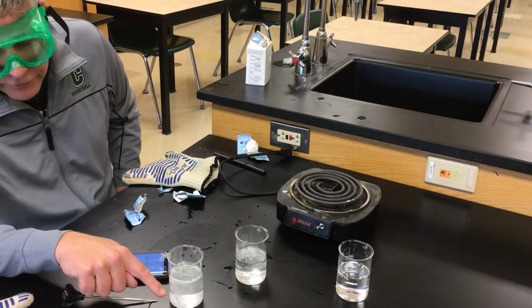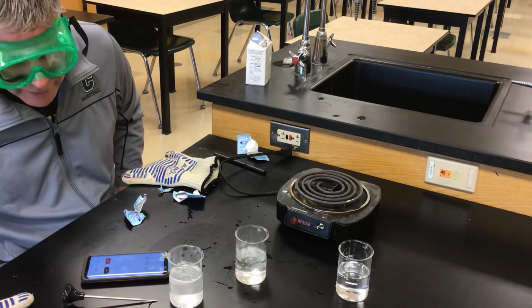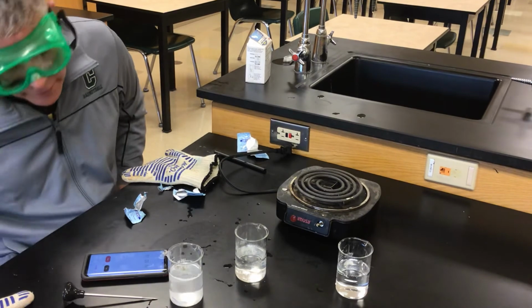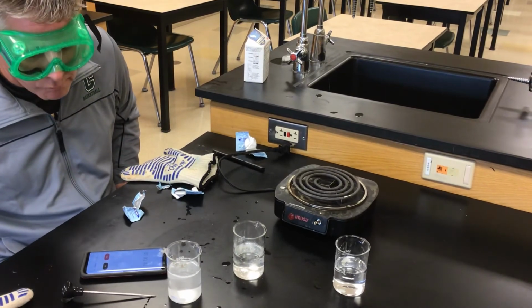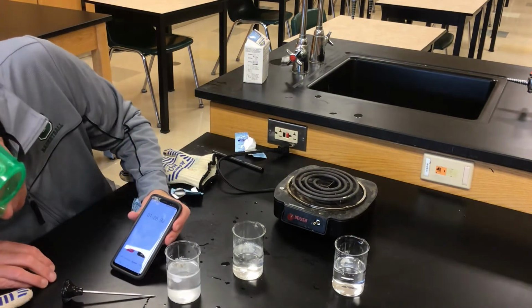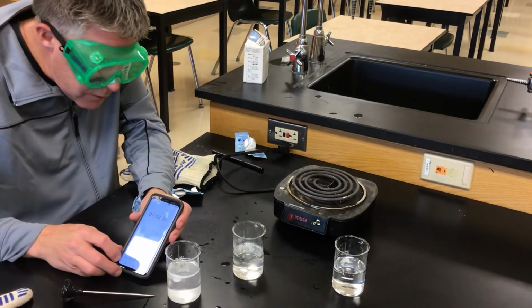It's interesting to watch it try to rise up a little bit. I don't know why. It's sort of fascinating to me. It's trying to get up there. We're at a minute. Did you watch the clock? Oh, popped up to the surface finally.